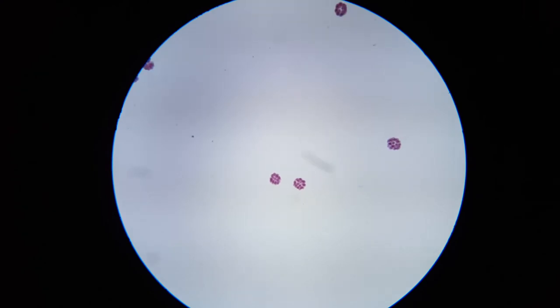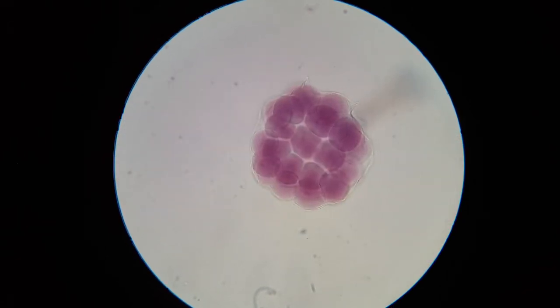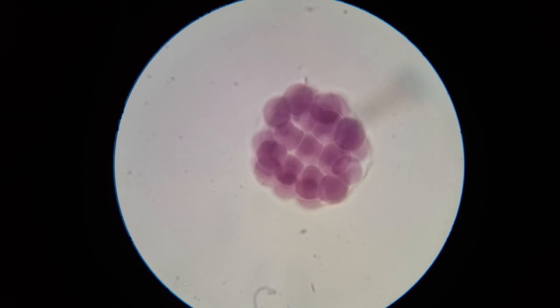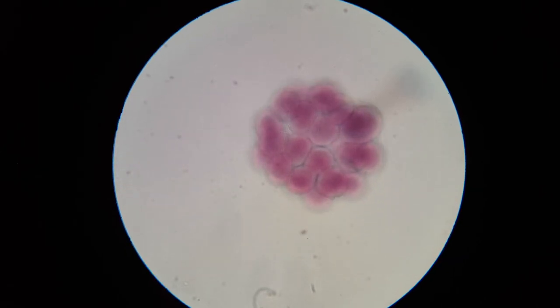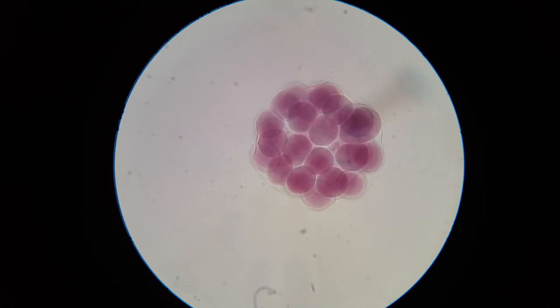Let's get those two centered. We're at 4x, switching over to 10x, getting them into focus. They look mostly centered — switching over to 40x. We're not going to quite fit both of them on screen. Remember, these are three-dimensional and kind of thick. Those are the cells on one side, and heading through them, we see more cells, more cells, and cells on the other side. We can look at this one and see more or less the same — so arguably, that's 32 cells.